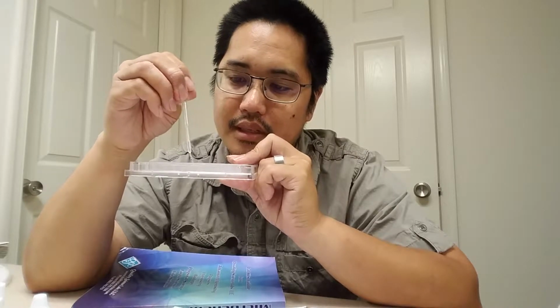I'm going to keep on doing this procedure. 1, 2, until I get to well number 7. Okay, almost there. 1, 2, and then put the rest inside of the well. So what I mean is I'm putting the excess back in well number 5. So I put some in well 6, and then I put all the rest of it that's left in here back in well 5. And then I'm going to mix it up. I'm just about done.